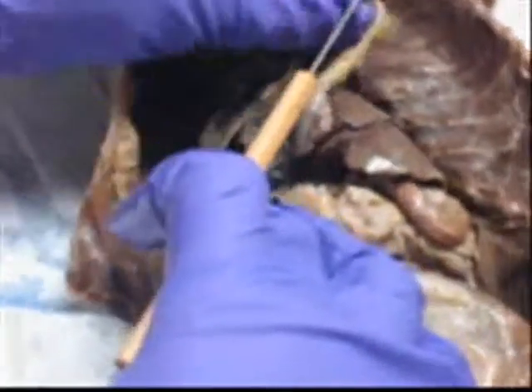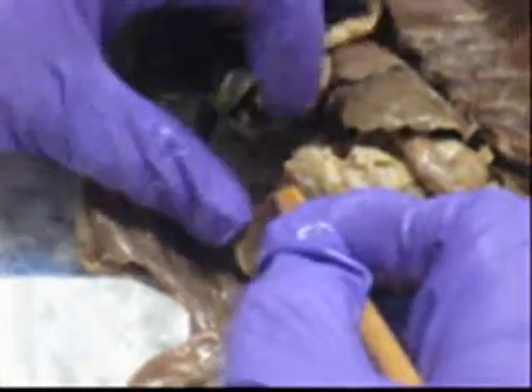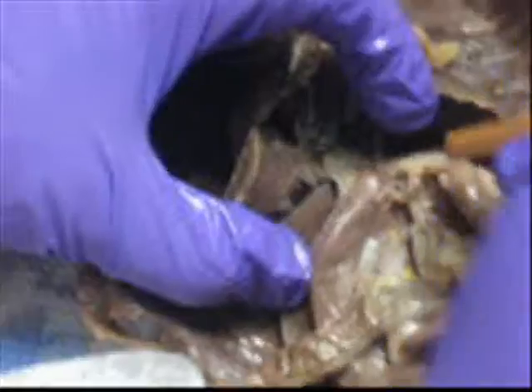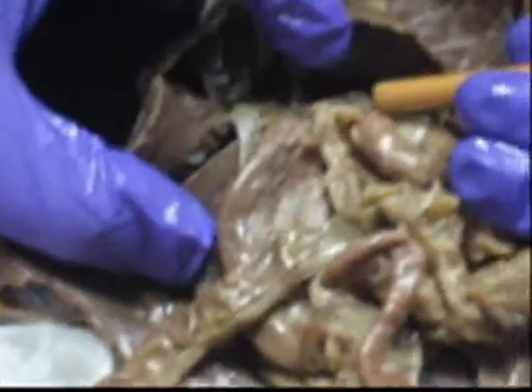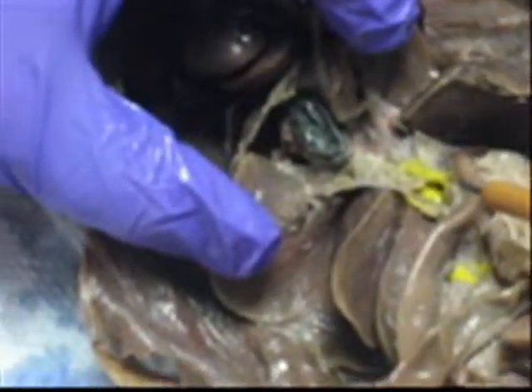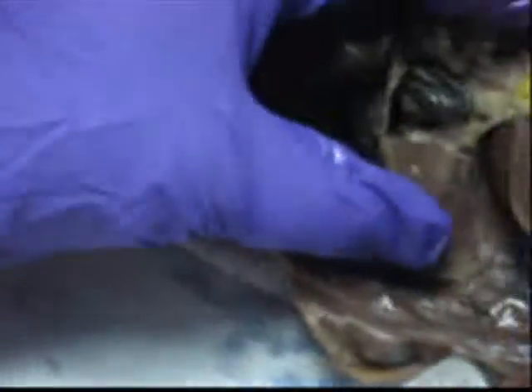The gallbladder is on this lobe, but in this mink it's not. So it's a little different. Gallbladder. So let's look for the cystic duct right here. You see it? Right there, cystic duct. And then hepatic ducts are next to it. There's a whole bunch of them. Hepatic duct, cystic duct, comes into common bile duct.